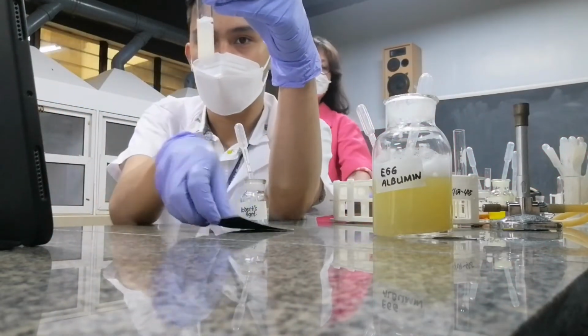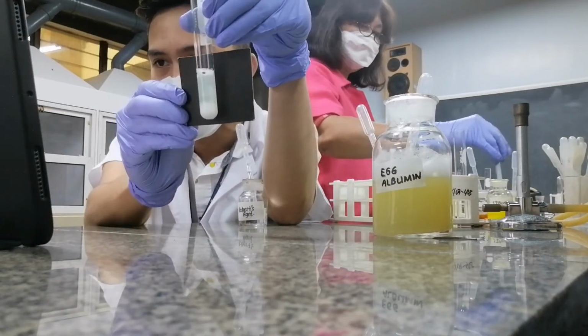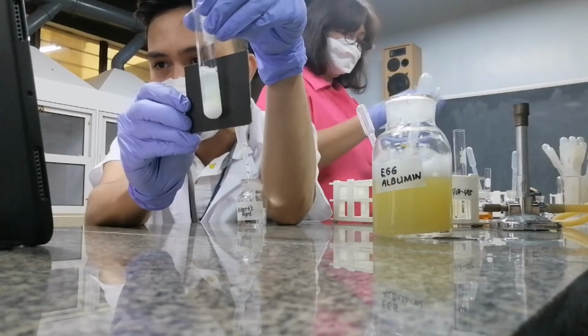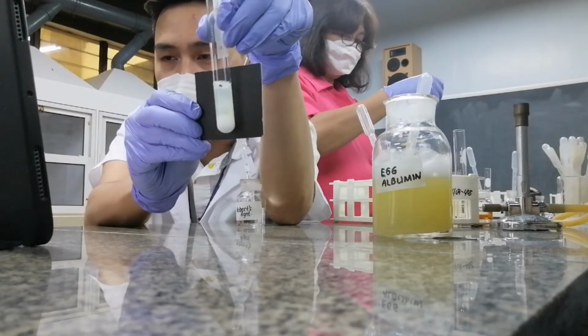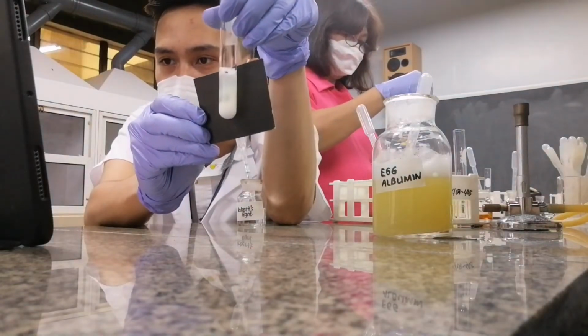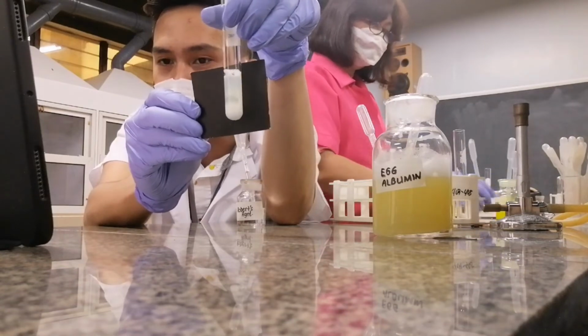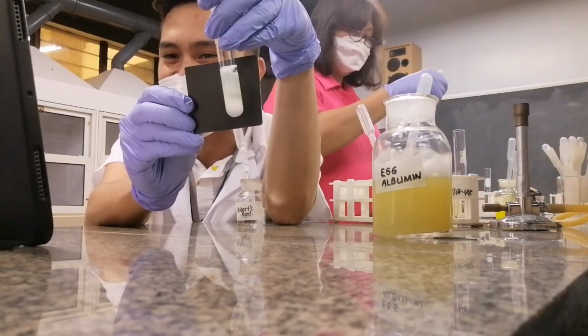Okay. So as you could see there, there is the production of what? What did you see? Upon the addition of the Robert's reagent, there's also the formation of a white ring, correct? Or white precipitate, but that's supposedly a ring.